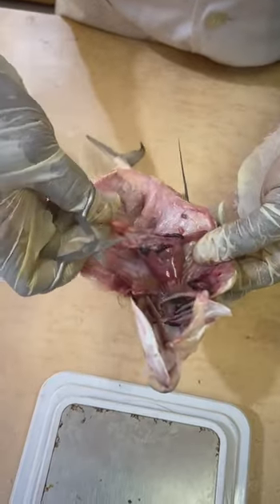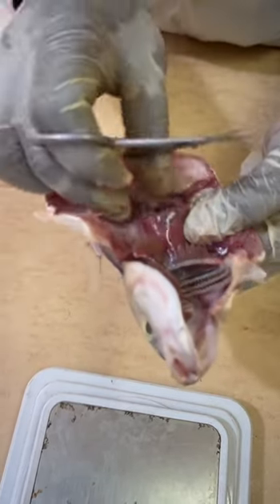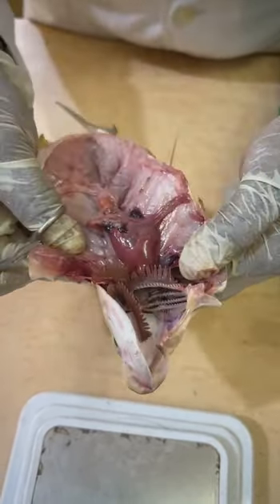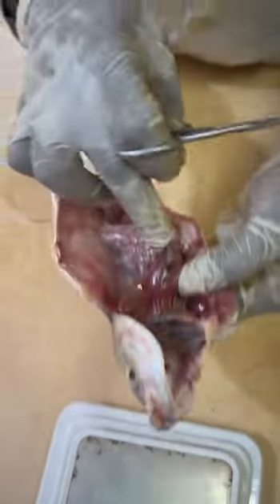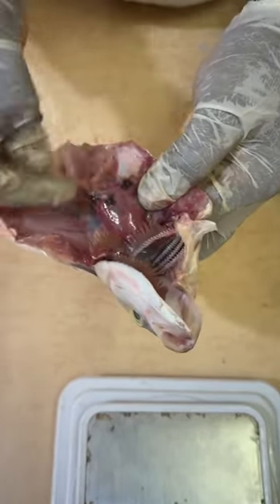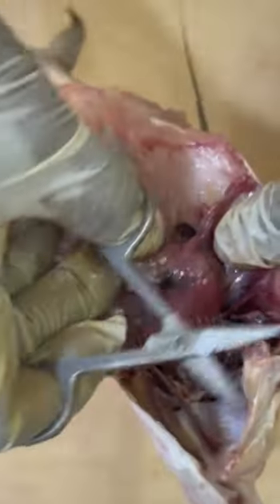I think the flesh. So the gonads, well, maybe because of the stage of development, like this particular fish, I would say it is not showing that it's a female. Okay, I'm coming. Let me see the way the gonads are.